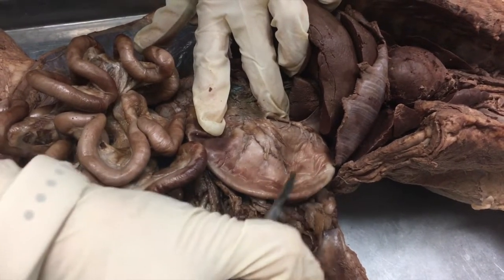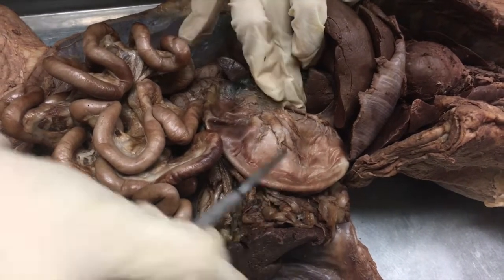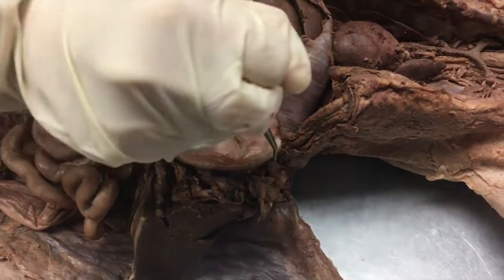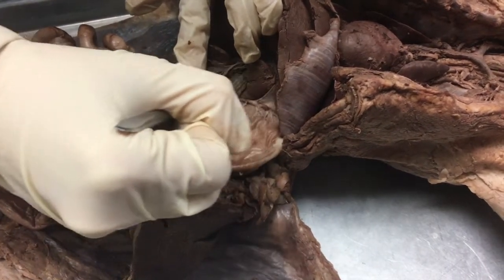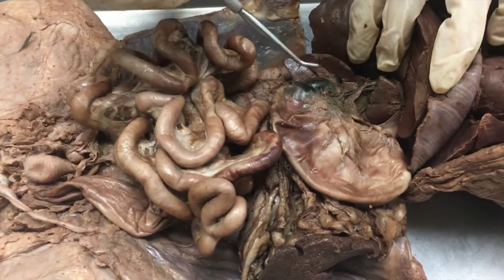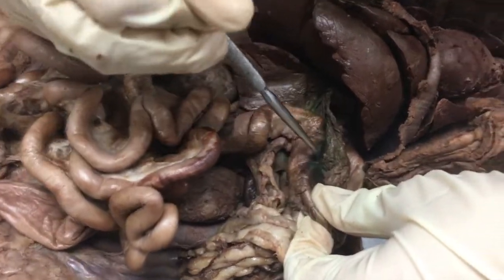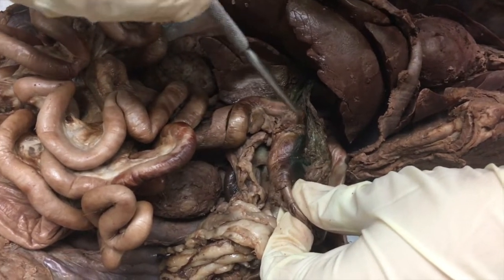We have the fundus here. This section of the stomach is called the body, and then we have the pyloric section of the stomach. We have the greater curvature on the outside and the lesser curvature on the inside. The pyloric sphincter, which you cannot see, is the muscle that controls movement from the pyloric section of the stomach to the duodenum — it'll be right about here.